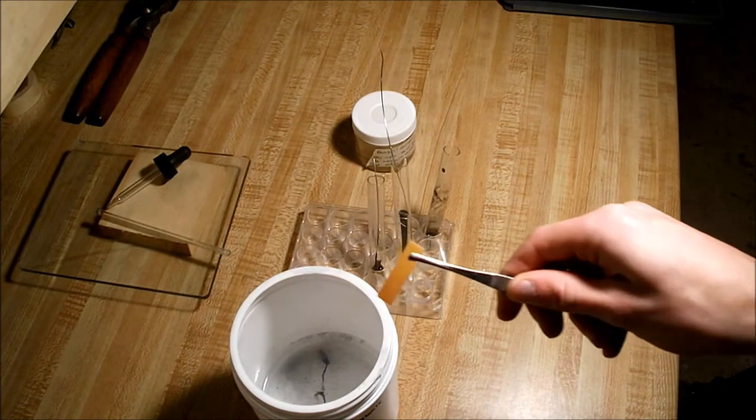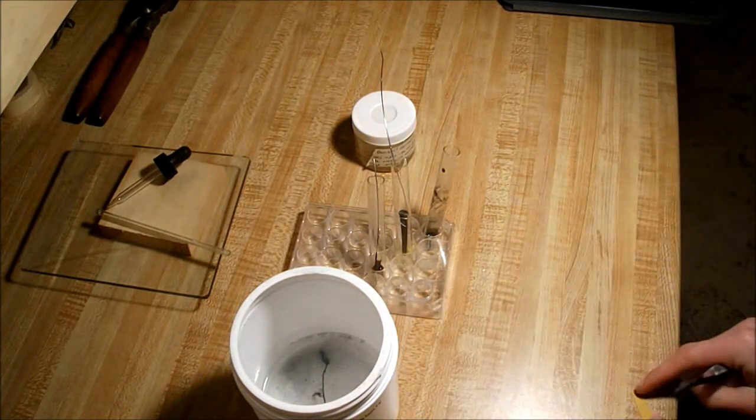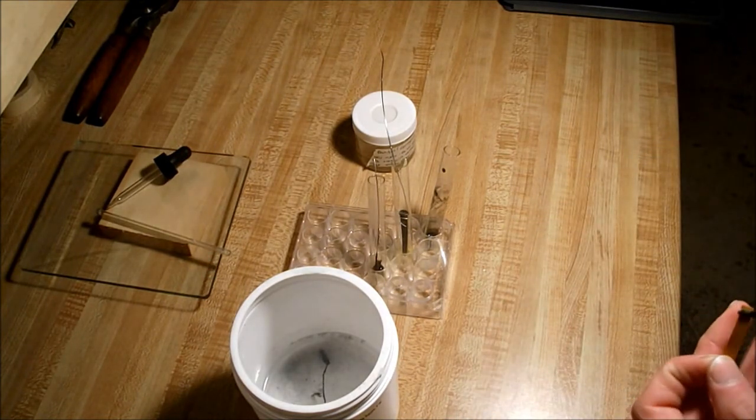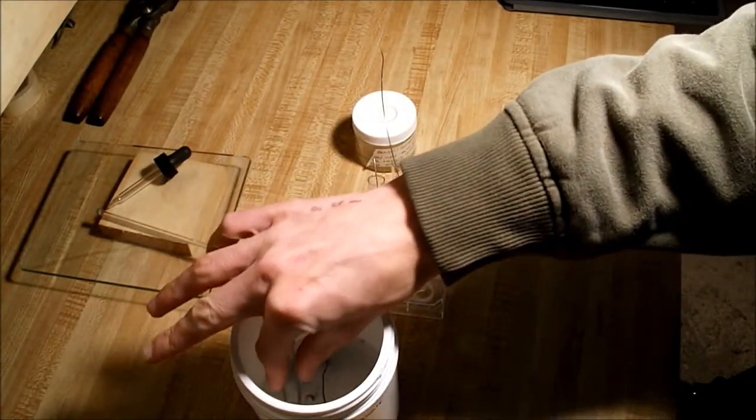I'm going to take my pH paper, which has been exposed to acid fumes, so it might not be entirely accurate. As you can see, it turned red, indicating a very low pH, and I'll drop that in there.